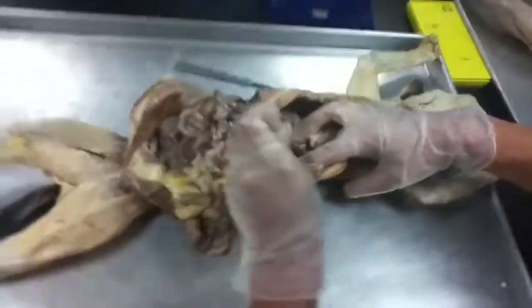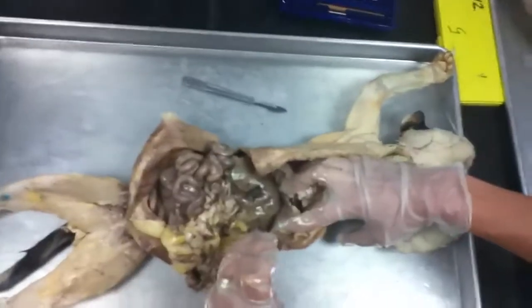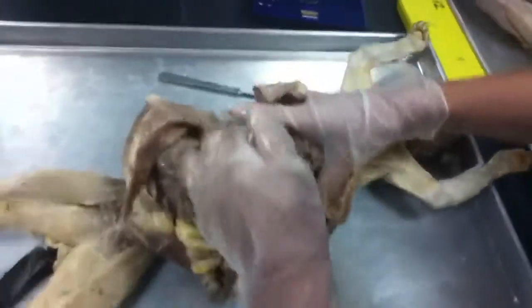Beginning of the year should have hopefully helped you. So left medial, and then the one to the side is going to be left what? Lateral. Good. So left medial, left lateral. Okay. On the right hand side, this one right here is all one lobe.